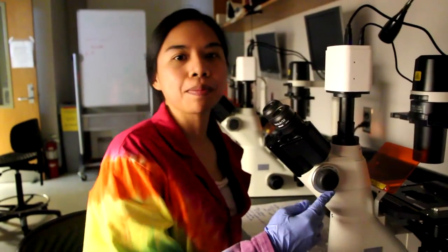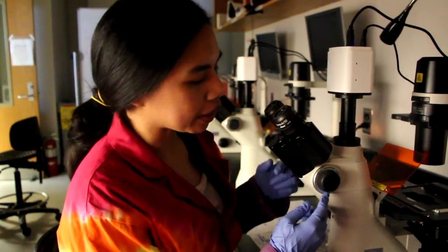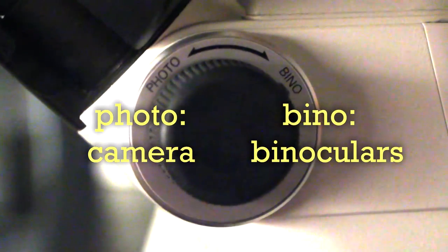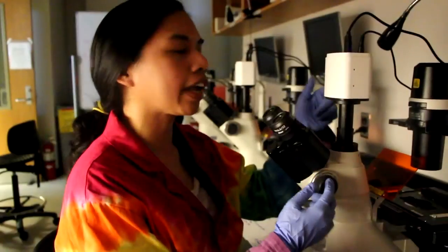So this is a very important knob for you guys to know about because it switches the light or the direction of the light between the eyepiece and the camera.